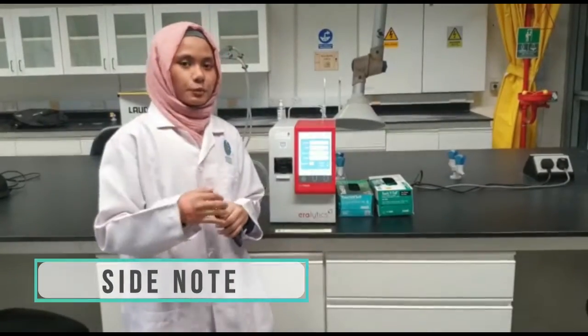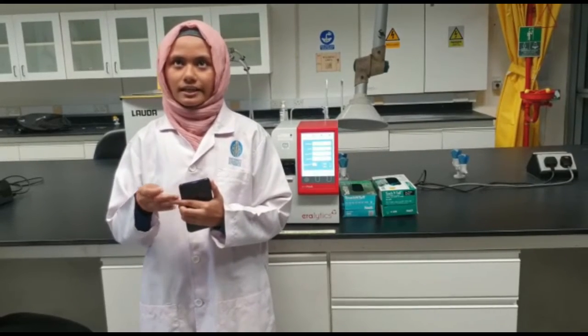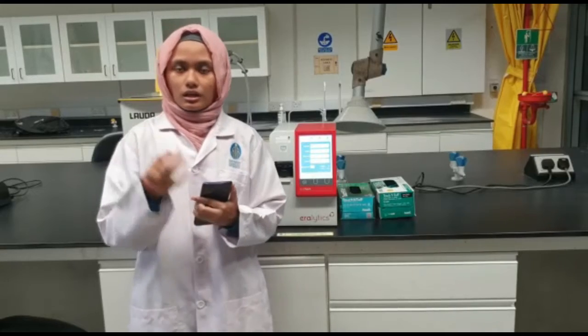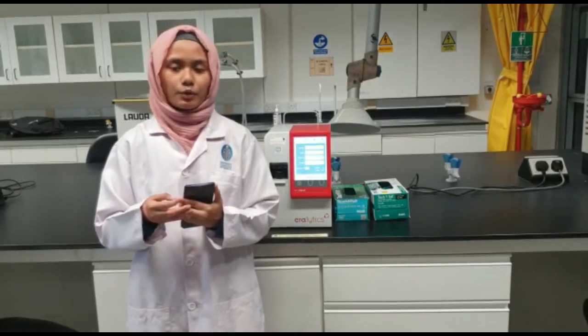When transporting dangerous material, we should know the flash and the fire point of the material. This is to prevent the flash and fire point temperature from being reached, as it can cause ignition in the vessel and an accident can happen. So in this experiment, when we have the flash and the fire point, we can ensure the optimum temperature for storing and transporting the material, so we can ensure the safety of the workers and the property.